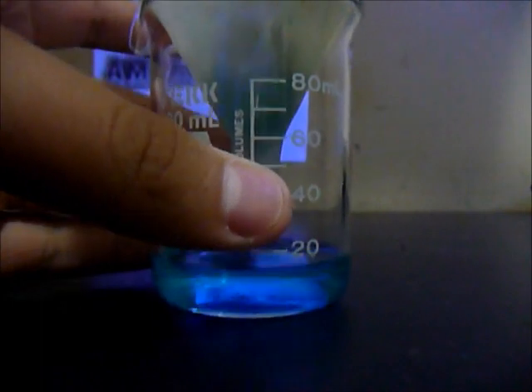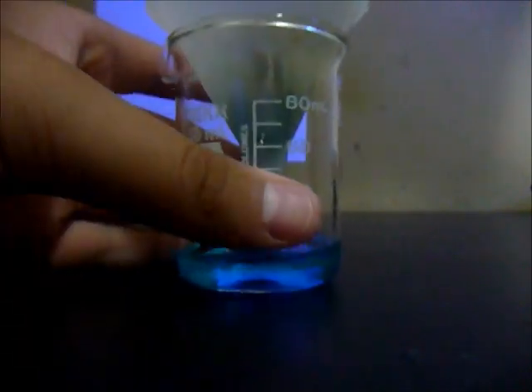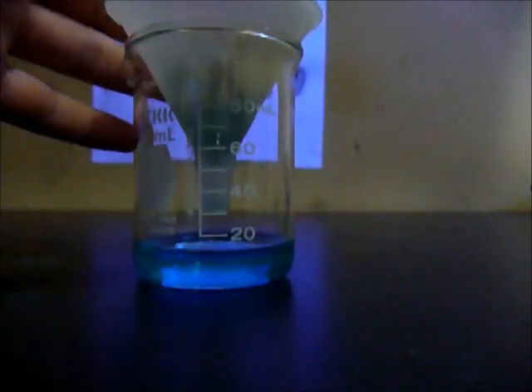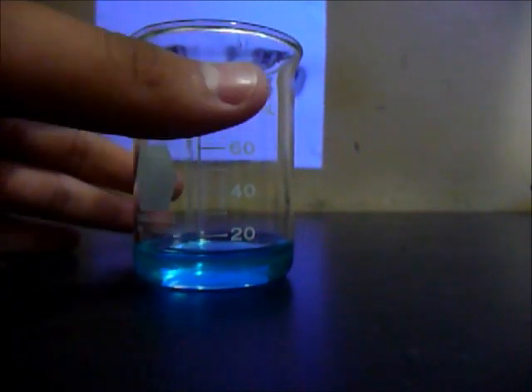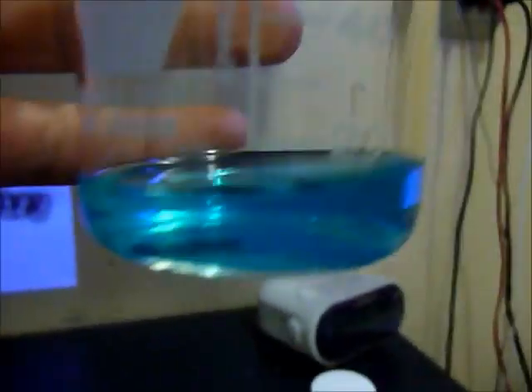So it has been about 5 minutes and it is almost finished. And you can see a blue color because that is copper sulfate. It looks clear in the light but it is not. Let me just turn off the light and see. You see that it is blue.